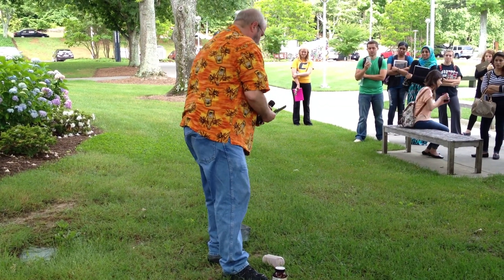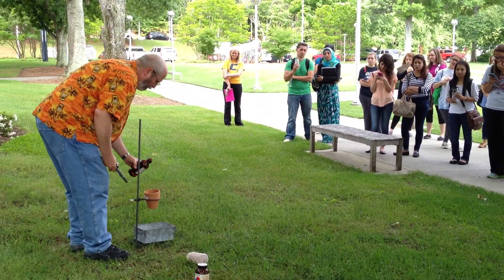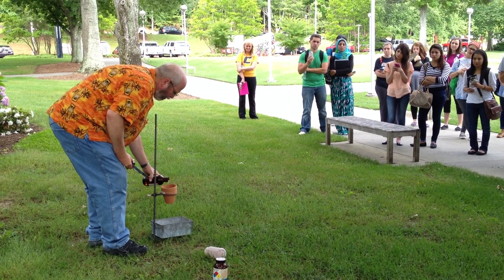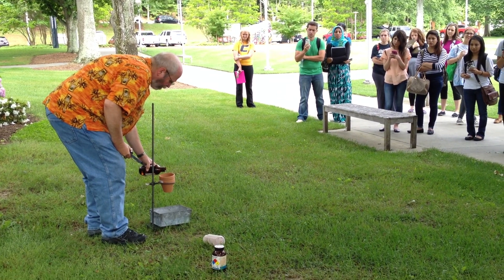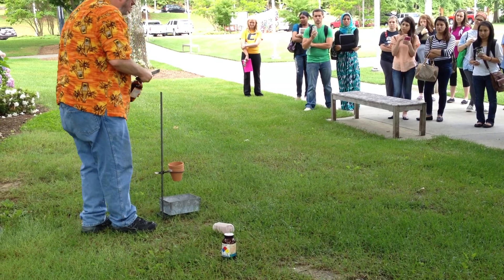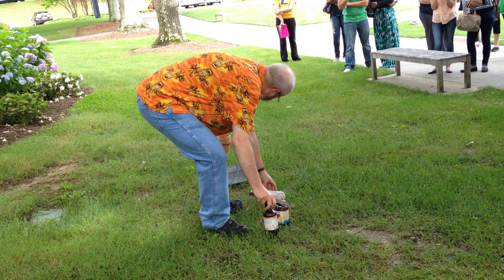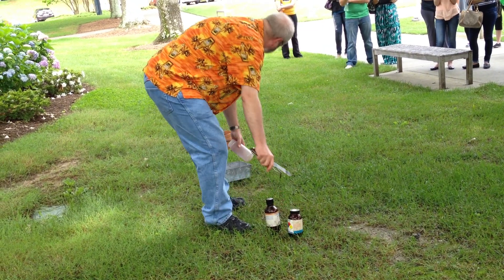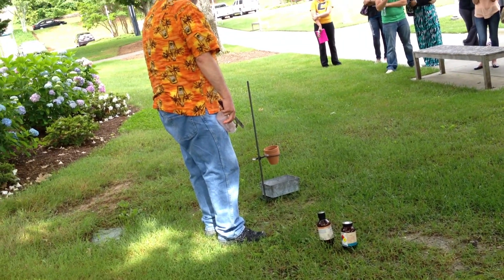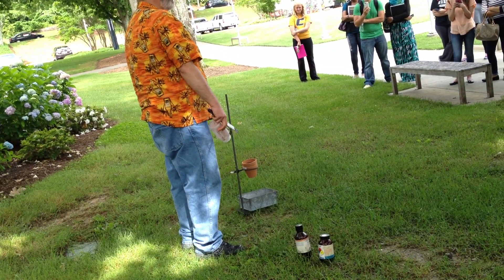The glycerin is very thick. It takes a few minutes — we'll see it turn and smoke. Like I said, I hope it works. Sometimes it just doesn't work, and if that happens I'll just apologize and say maybe next time.